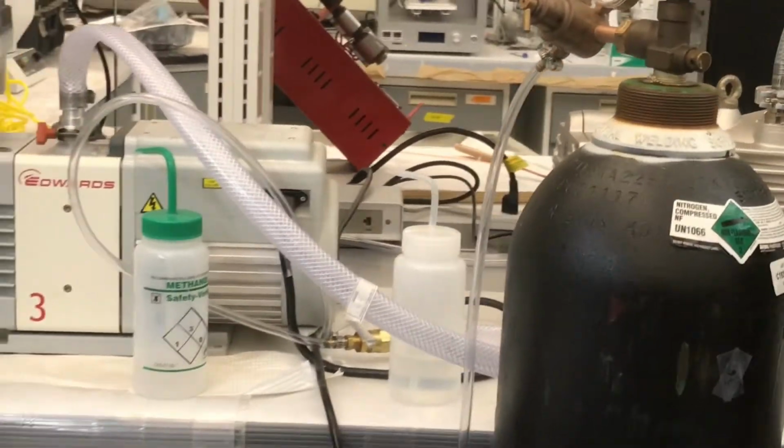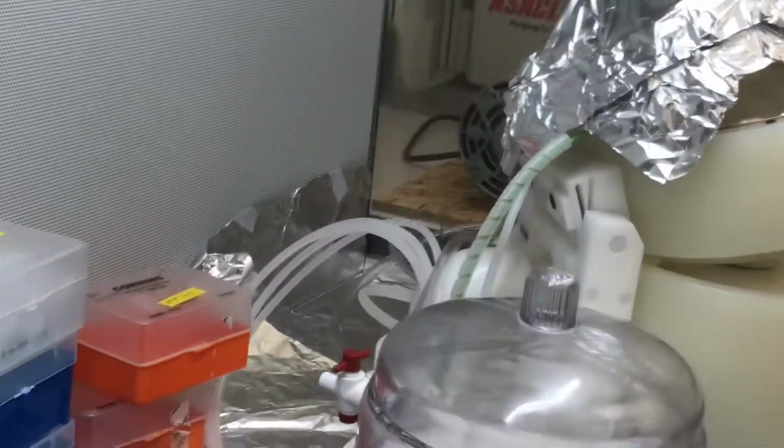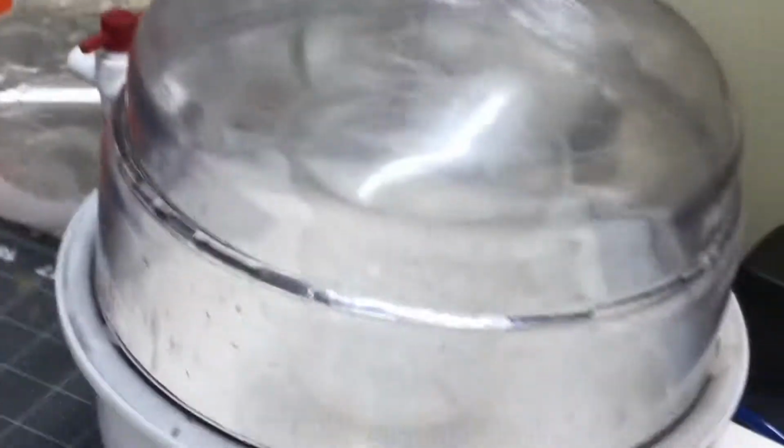I see. Yeah. Good. Are you done with that? No, still. So here we see some bubbles, no? Yeah, still.